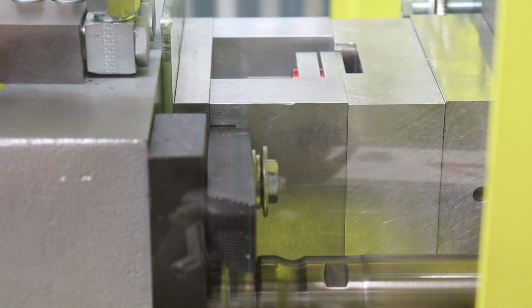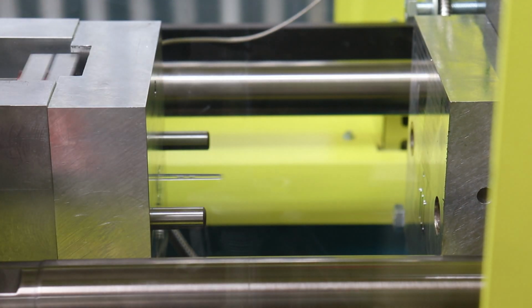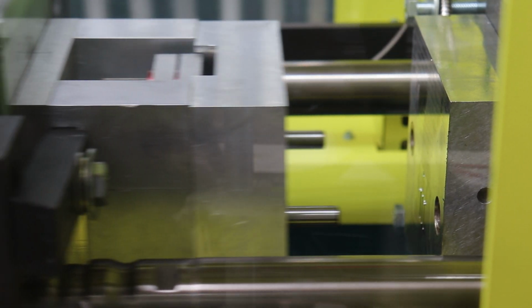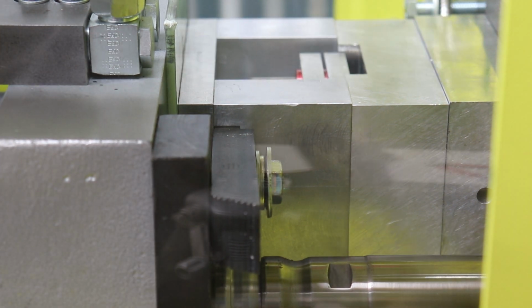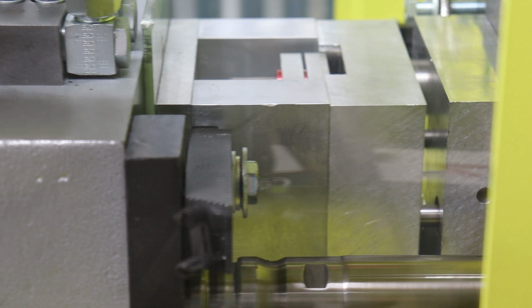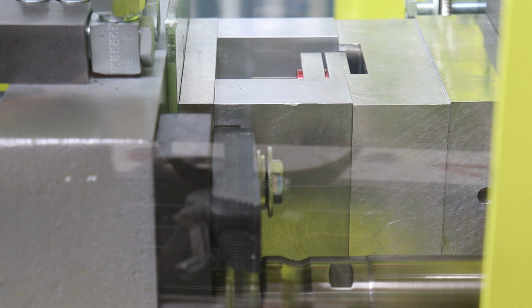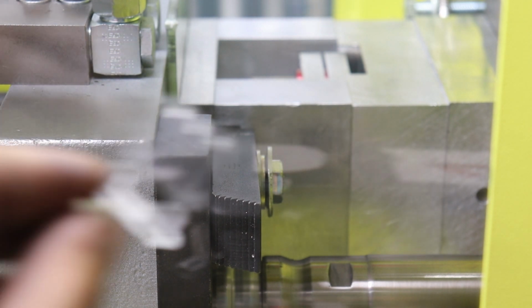There we go. Let me give you a better view. Yeah, I may need slightly more travel on the ejector too. But it's nice to see that it's running in full automatic after the second part, basically. Oh, actually, it's not filling all the way. I think I need to increase the pressure. I'm looking at... well, I can show you the part here.